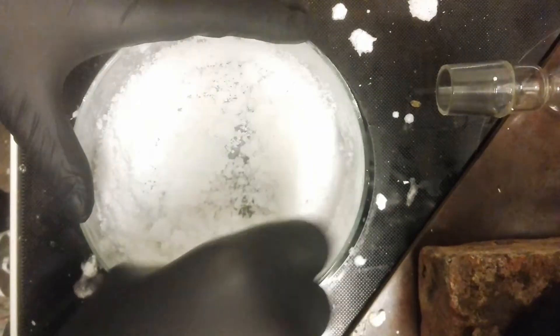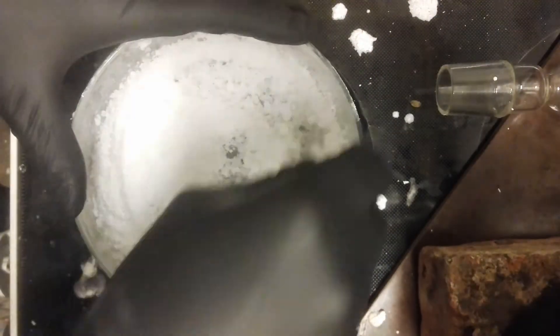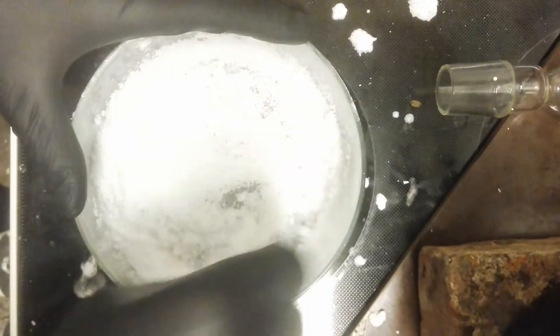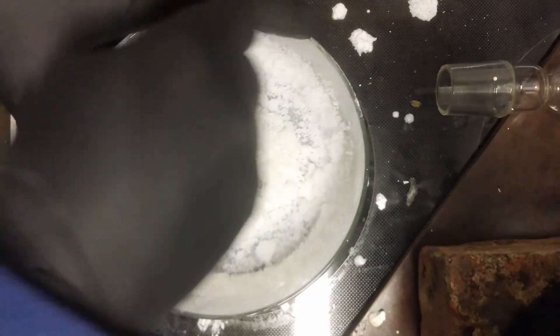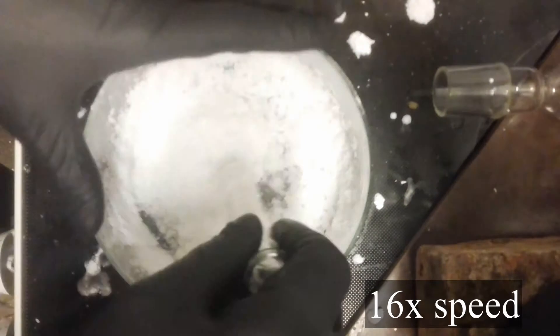So, the best way we found out is to let the solids dry on a filter paper and after that heat dry and crush it somehow. We used a dish for that with a weird piece of glass, you can also use the bottom of a beaker.